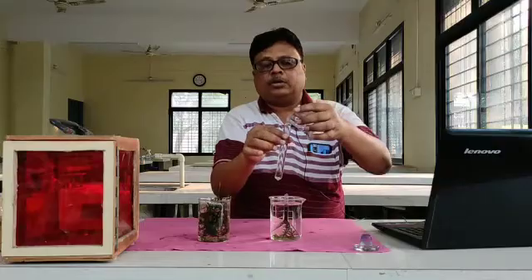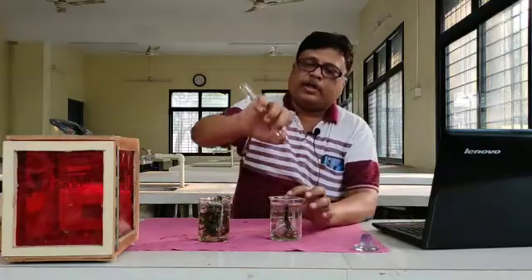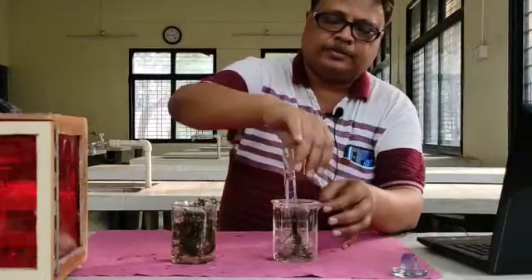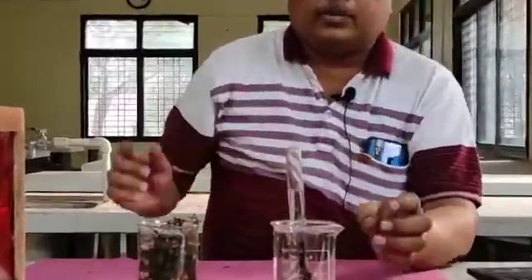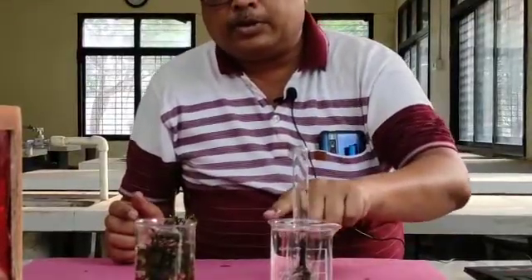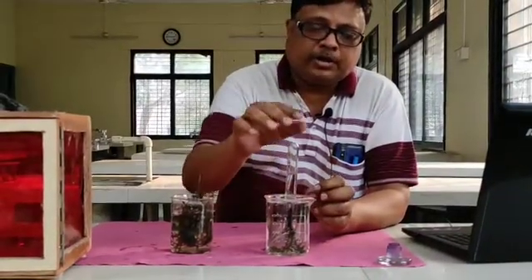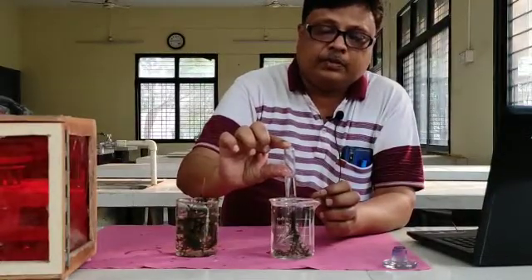Fill the test tube with water. I have filled it with water, and with the help of your thumb, just invert this particular test tube over the surface of the funnel. The funnel is larger than the shape of this particular beaker, so the water level is not maintained as expected. But in a typical condition, this test tube is generally filled with water.